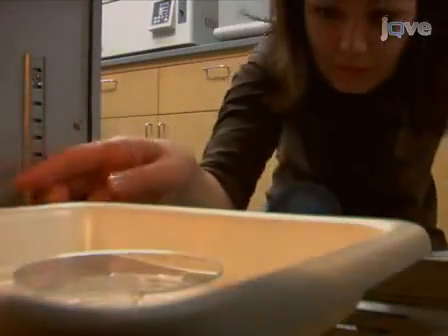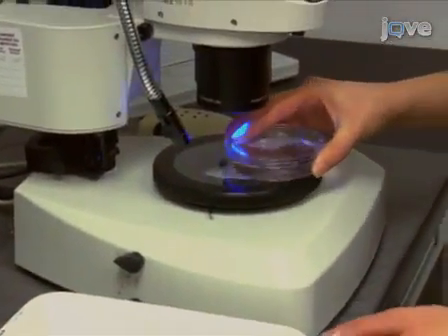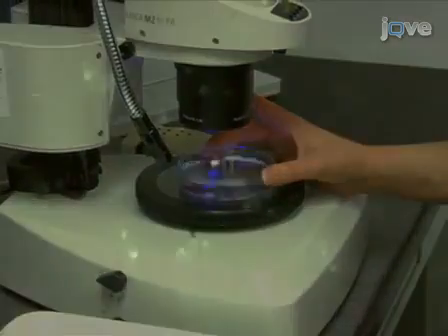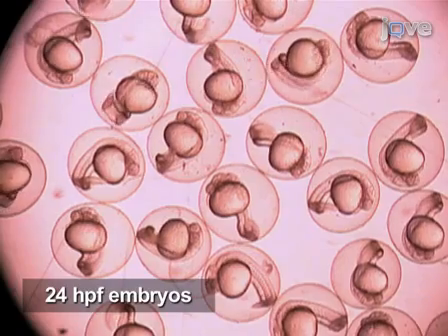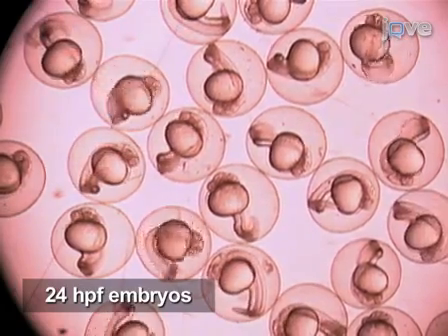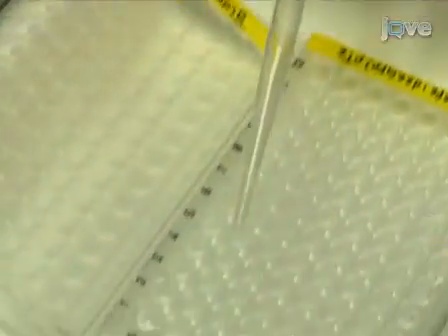The next day, place the embryos under a fluorescent stereo microscope to sort the transgenic embryos for similar stage and uniform GFP expression. 24 HPF embryos show a visible mid-hindbrain boundary with intense GFP expression and well-formed eyes with GFP-positive dorsal retinas. These embryos are active and will move and wiggle in their chorion. Using a plastic Pasteur pipette, transfer the 24 HPF embryos one at a time to individual wells of a 96-well plate.